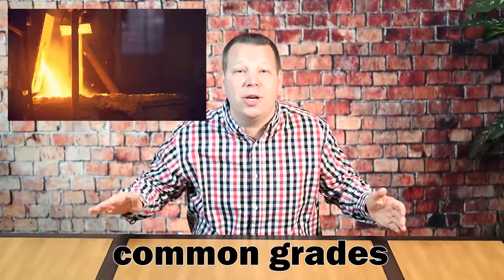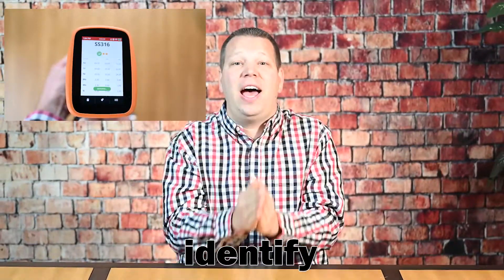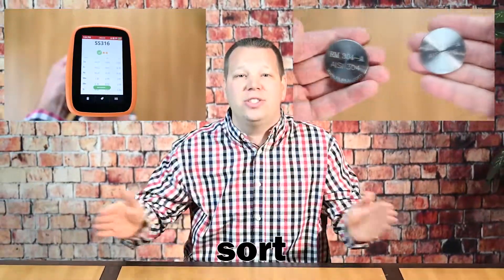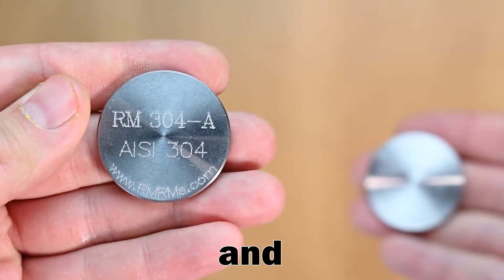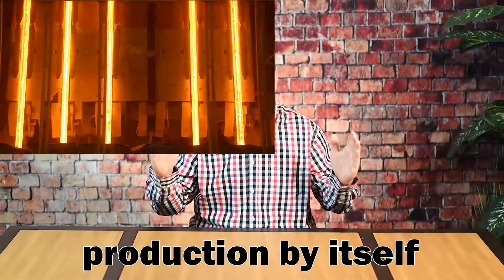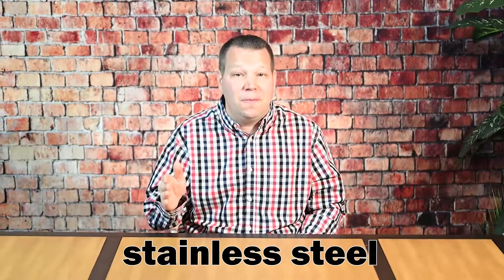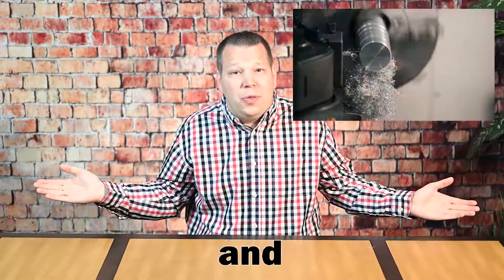304 and 316 are the most common grades of stainless steels produced, and while they look visually similar, they are easy to identify and sort with the right technology. Hi, I am the Alloy Geek, and in this video we learn how to identify and sort 304 and 316 stainless steel. You've probably come across 304 and 316 stainless steel without even knowing it. In fact, 304 represents about half the global stainless steel production by itself, with 316 right behind as the second most commonly produced stainless steel. If you've clicked on this video, you probably want to know: how do I sort my 304 and 316?